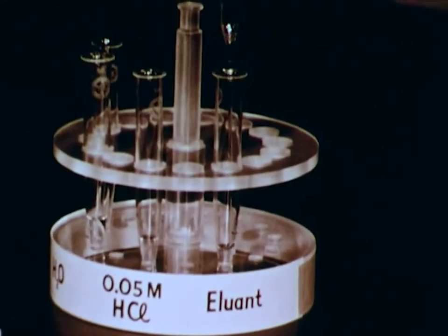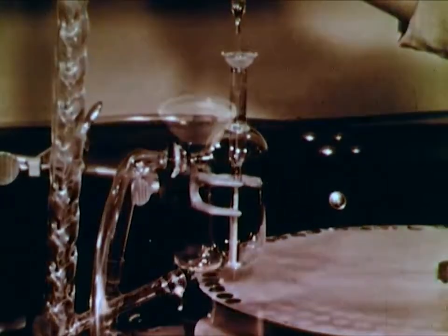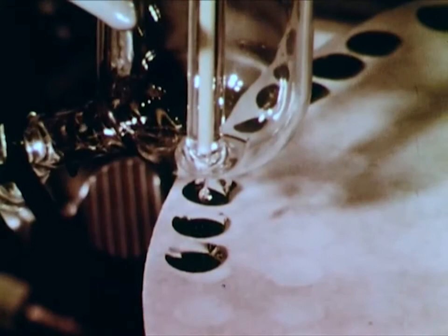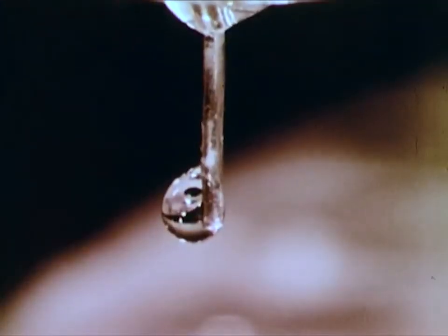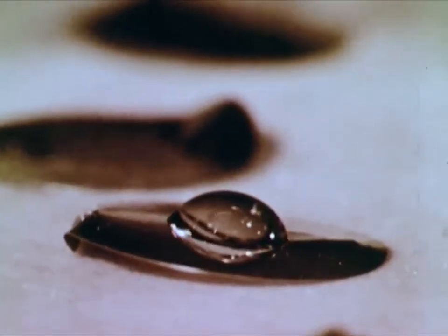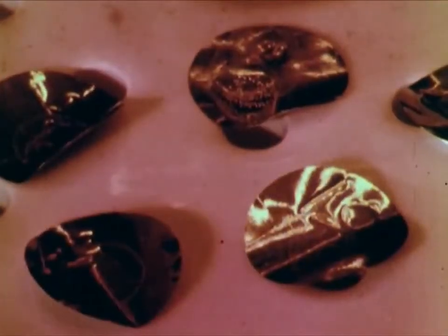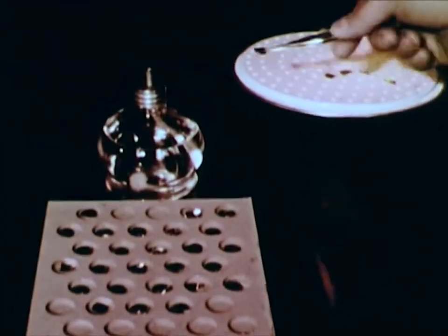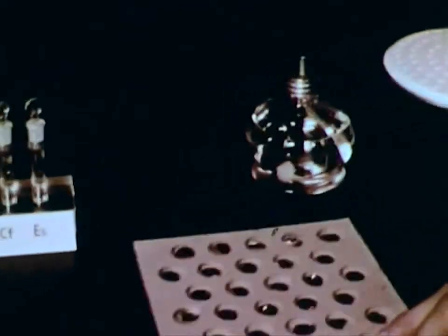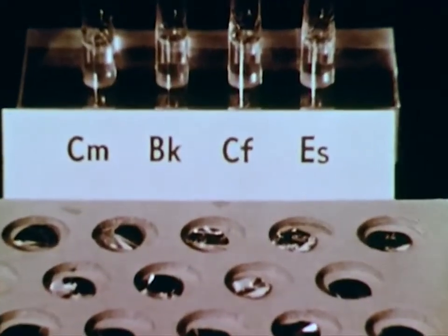The level of radioactivity is quite low, therefore it's safe to work with them in the open. A solution called an eluent is added to flush the actinide elements through the column. Applying air pressure to the column increases the rate of flow. As the drops of eluent fall from the column, they are collected on platinum disks. Each disk receives only one drop. The disks are dried under an infrared lamp, leaving minute amounts of the elements plus solid residues of the eluent. Flaming a disk in an alcohol flame burns away the eluent residue.